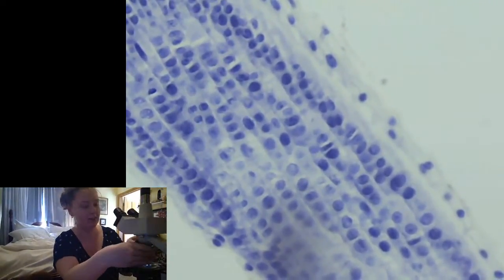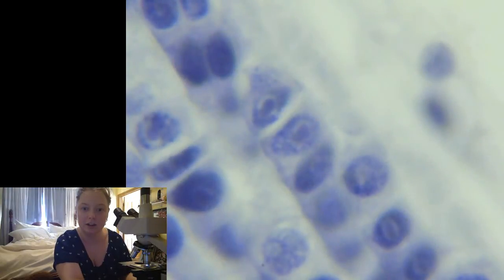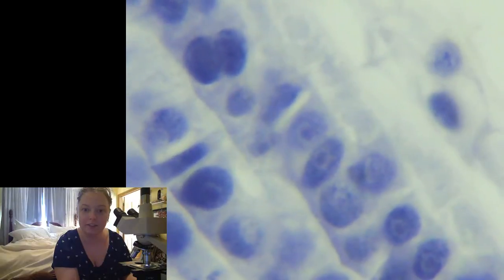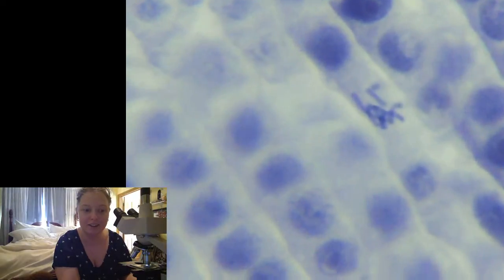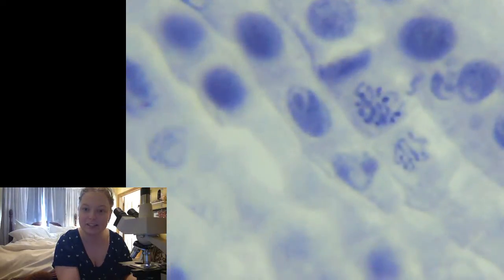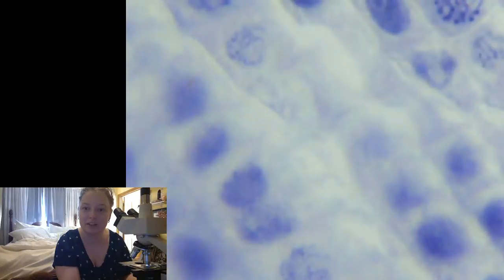So then let's see if we can go one more. Oop, a little bit blurry there. All right, there, let's see what we can see. Hi, Sophie. All right, so here we go. You can see some chromosomes around.